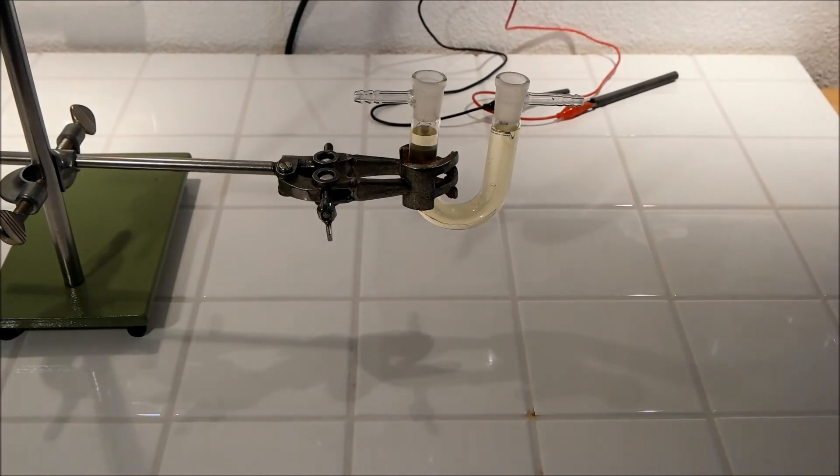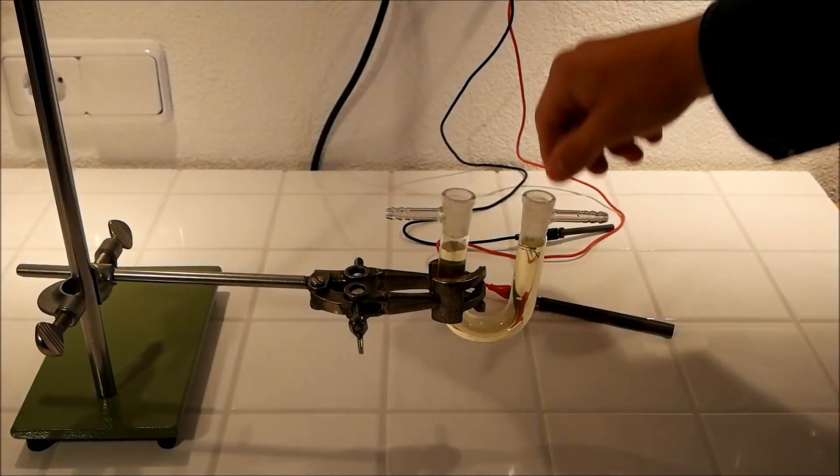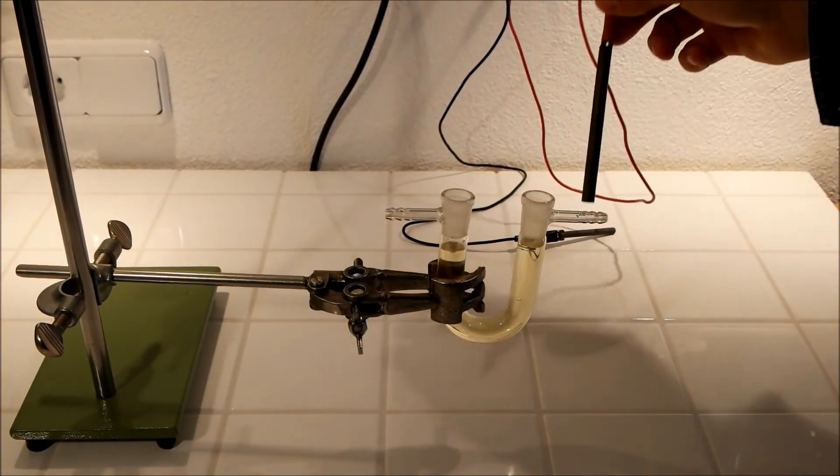And this is our zinc iodide solution in the u-tube. Now put your electrodes in the zinc iodide solution.